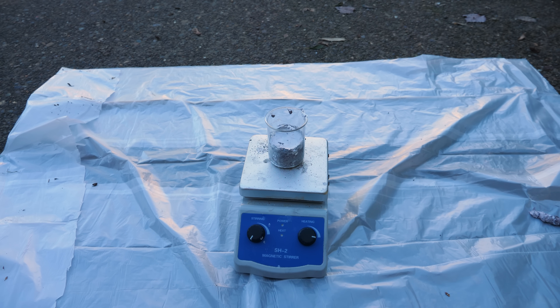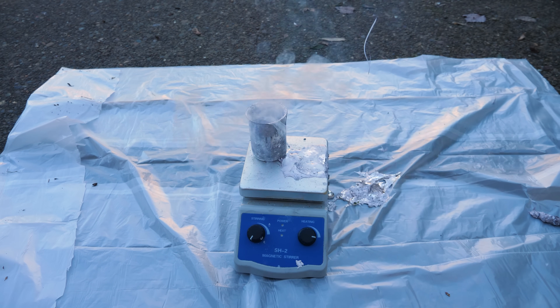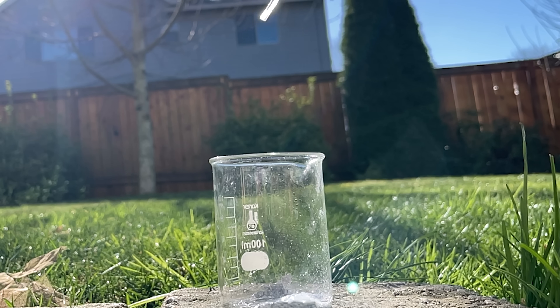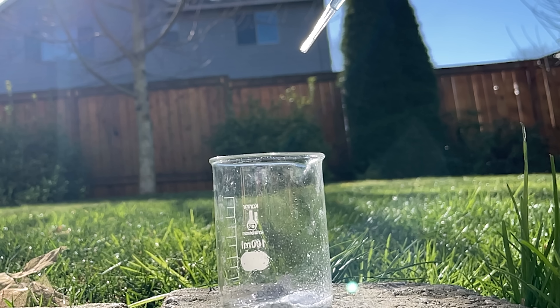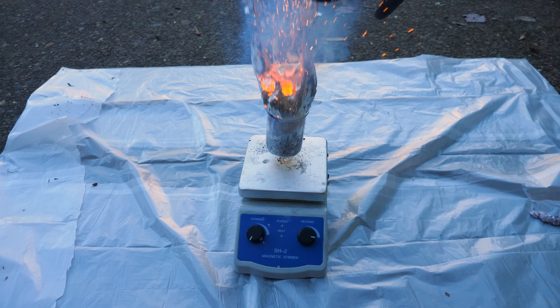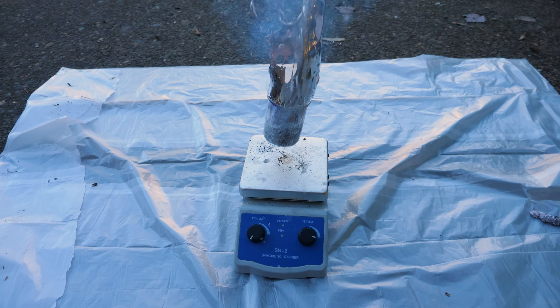So in the case with the ice, I didn't really expect it to explode as instantly as it did, especially because in a smaller scale experiment I dripped drops of water on liquid sodium and it just fizzled on top — there wasn't a big explosion. But with the larger scale, that's definitely not what happened. I'm not sure exactly what the mechanism was here, but it sure looked like a Coulomb explosion, and there was also some fire involved from the instant it dropped in there, so maybe it was from the hydrogen burning as well.